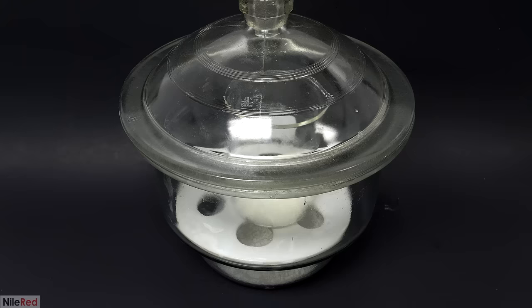As an extra little test, I dissolved more of the MOED in acetone and I added several drops of acid. And as I more or less expected, the violet color very quickly disappeared. So to sum this all up, the color of the MOED depends mostly on the polarity and whether or not the solvent is protic. When I first started this project, I thought that the color would correspond directly to a specific polarity, but that clearly wasn't the case here. This might be true for other solvatochromic chemicals though and I plan to explore this in future videos.